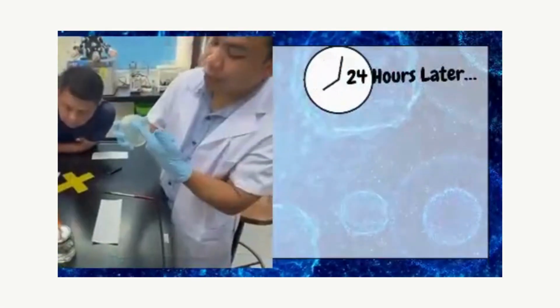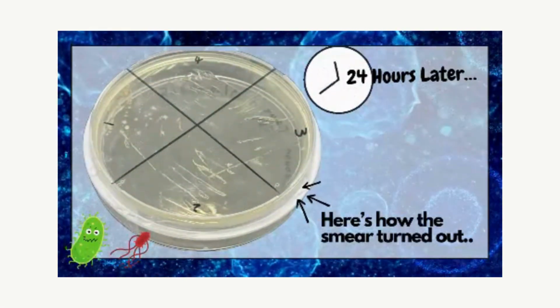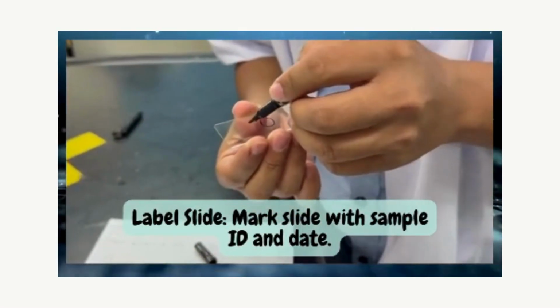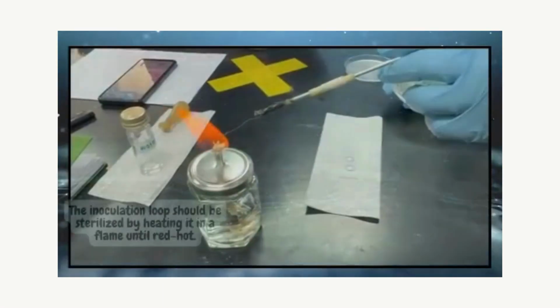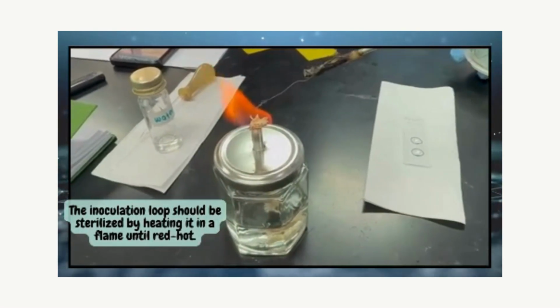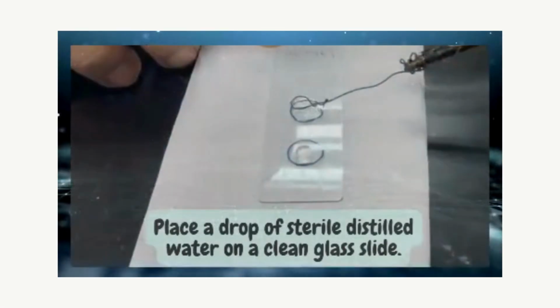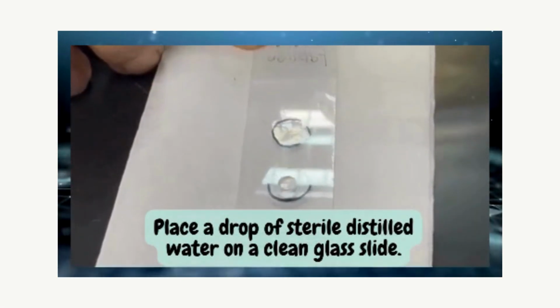After 24 hours, our bacteria culture is ready for staining. Let's begin. First, label the clean glass slide with the sample ID and date. The inoculation loop should be sterilized by heating it in a flame until red hot, and allow it to cool before touching any culture. Place a drop of sterile distilled water on a clean glass slide.